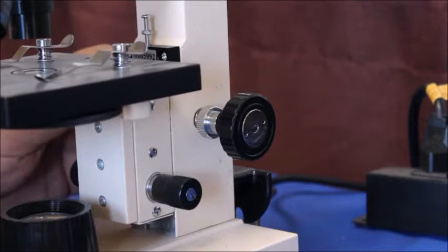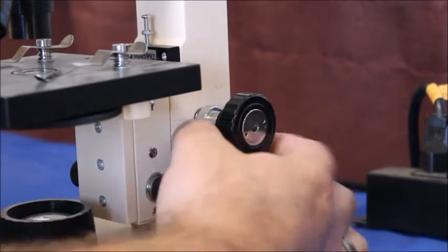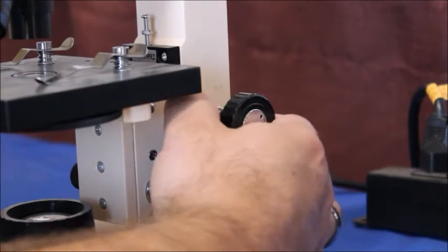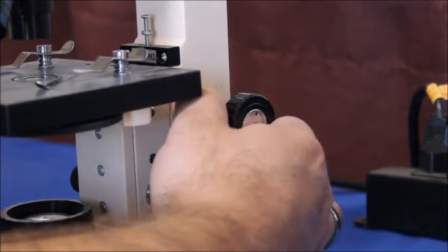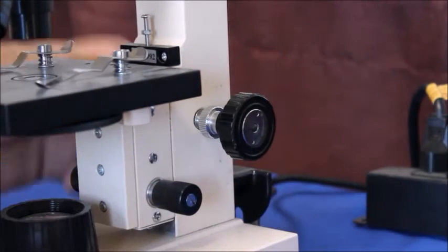You'll especially notice it on the higher magnifications. So what we're going to do is adjust this little knob right here and you'll notice it starts to get a little bit tighter until you get to the point where it'll hold its position but it's also not too difficult to turn.